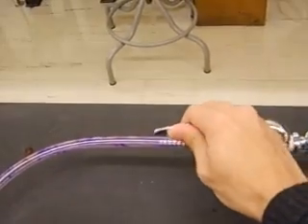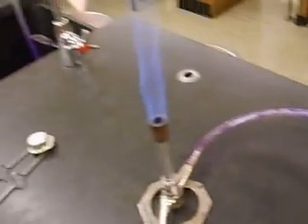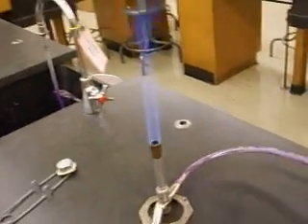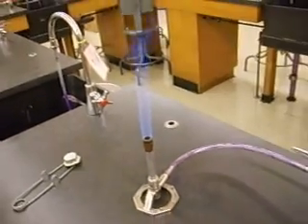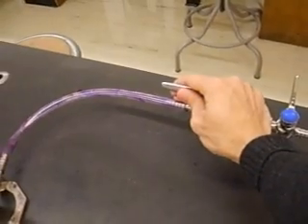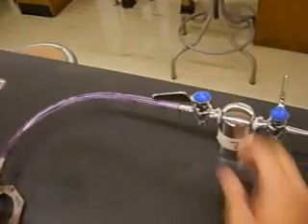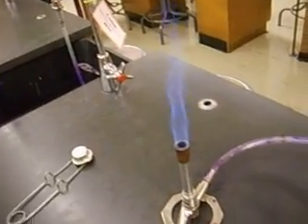So by all the way, we mean all the way parallel. And when it's all the way parallel, check out how big the gas is now. So again, you don't need it that big. You just need a moderate amount of gas. A moderate amount of gas is what you want.